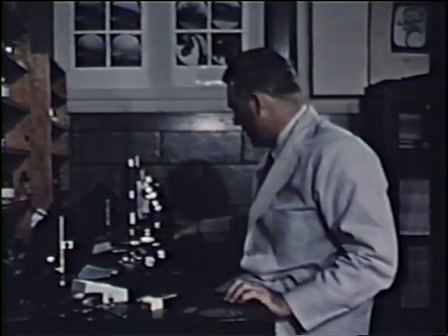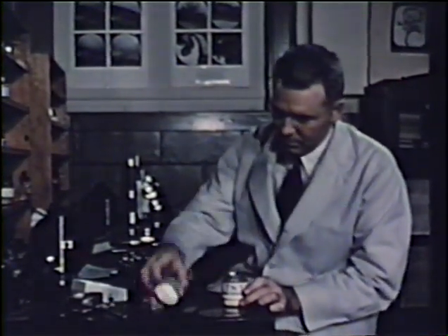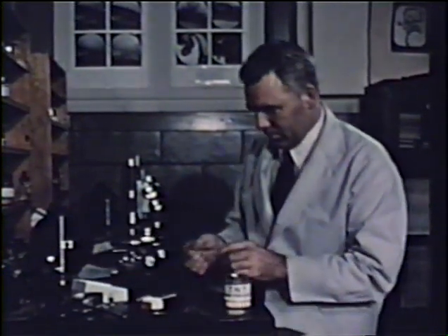The stage is heated rapidly at first, but at a standard rate of 3 degrees centigrade per minute in the region of the melting point. The actual micro-melting point is read on the thermometer at the instant the last crystals disappear. The appearance of crystals as they grow from the melt is also very characteristic of any fusible compound.